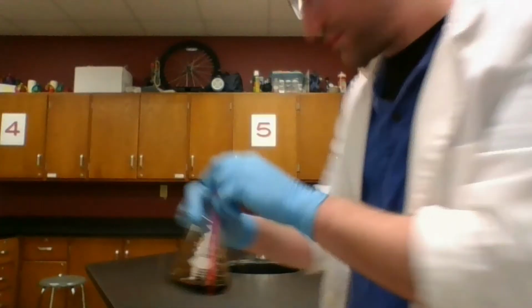All right, I've made it to a reddish-orange color. So what's going on here? Well, think about a can of soda that has some fizz in it. It's pressurized, it's carbonated, and we do that with carbon dioxide. Now when that carbon dioxide is shoved in there, it's not only becoming fizzy, in between the particles of liquid it also makes a substance called carbonic acid.